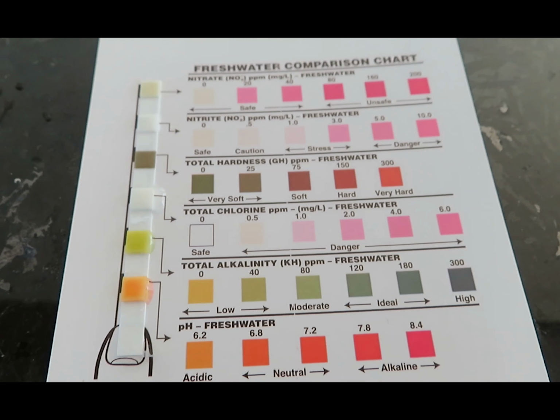While having no nitrate and nitrite in any of my samples was great to see, this means there's no obvious pollution taken, it is important to remember that this is just a snapshot of these water resources. If I were to retake some of these samples closer to right after a large storm event, I could find more examples of nitrate indicating higher levels of runoff.